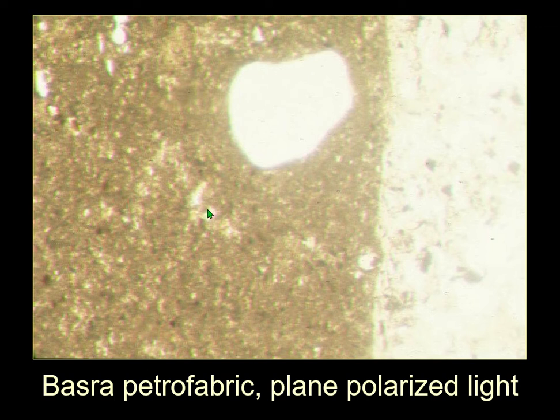And this is another old photograph. This is the Basra petrofabric, and it's quite fine. There's hardly any inclusions in it, which you might say if you were ignorant enough to just look at a little area here through a scanning microscope where you have an inconsequential sample size for doing petrographic analysis, you might think, oh, well, this lacks characterization, so therefore it has no characters.